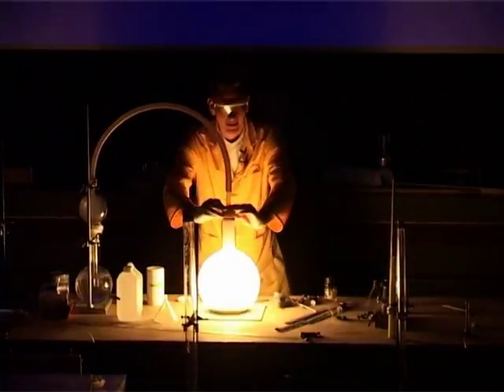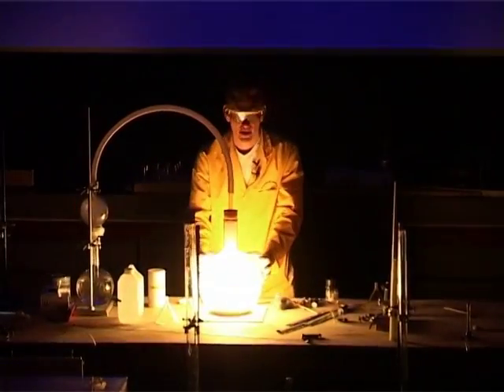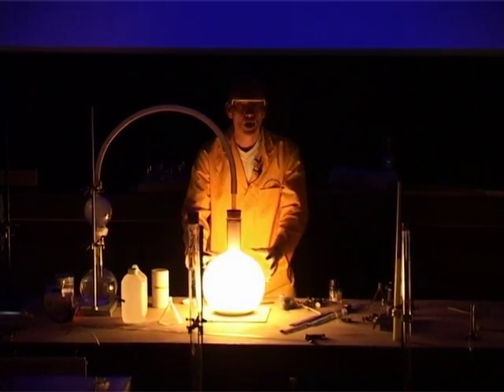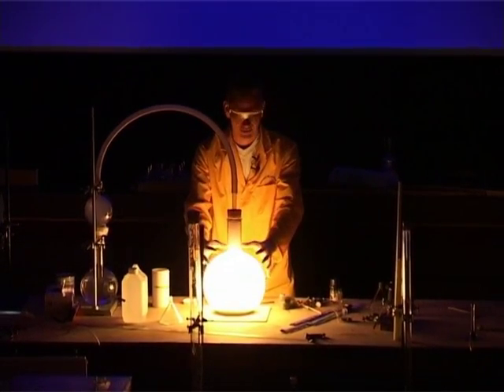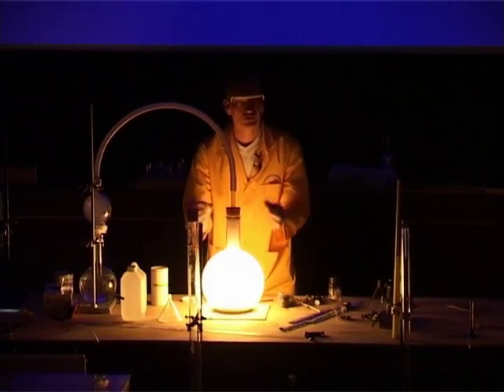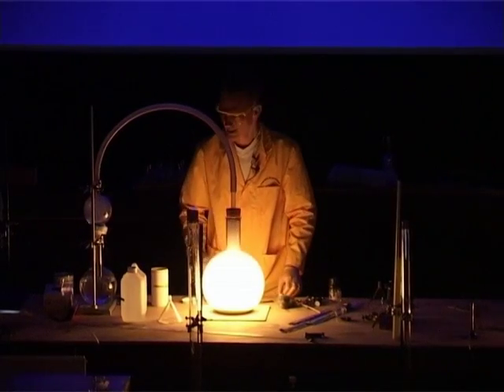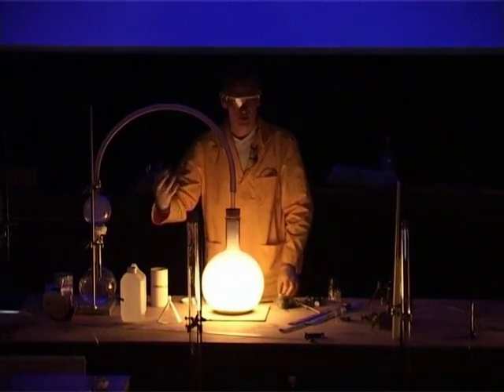Look at that. The light that we see here now is the reaction between this very reactive phosphorus burning with the oxygen that's in the air inside this flask. And it's making phosphorus oxide. This is a chemical reaction, but this chemical reaction is giving out light as well as heat.